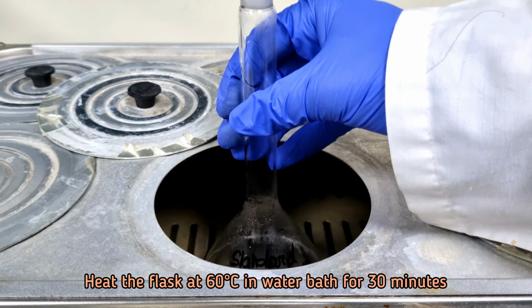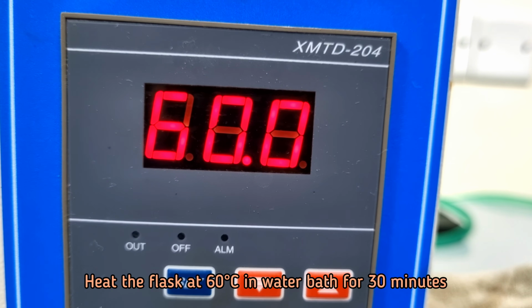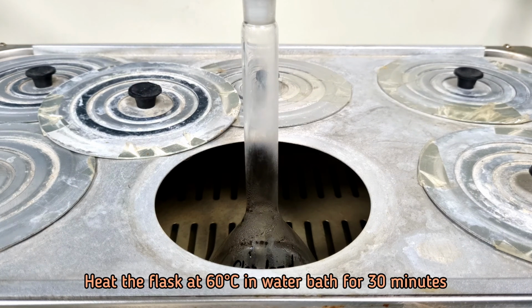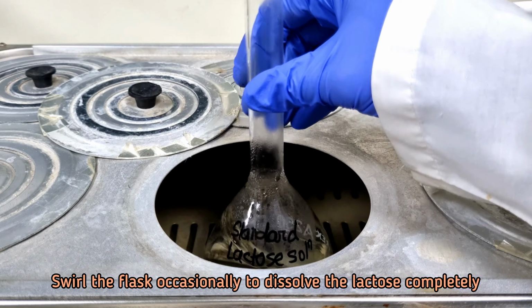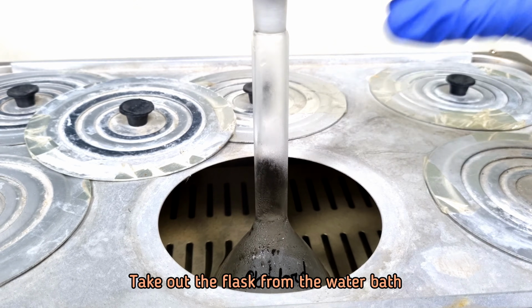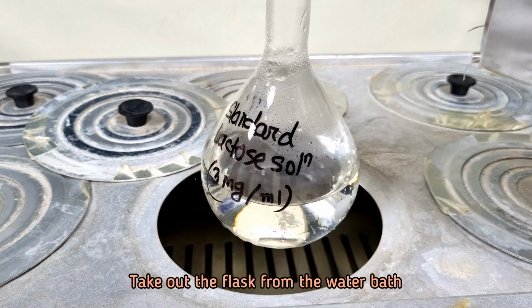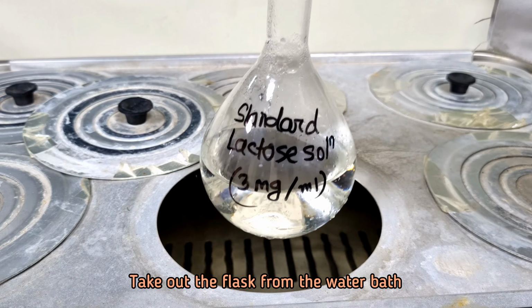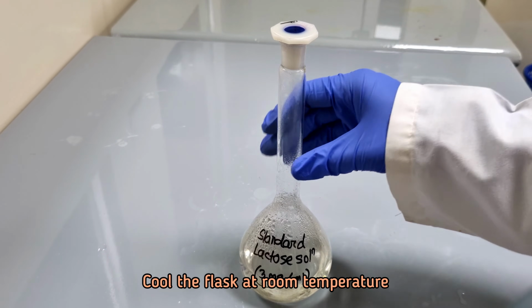Heat the flask at 60 degrees Celsius in water bath for 30 minutes and swirl the flask occasionally to dissolve the lactose completely. Cool the flask at room temperature.